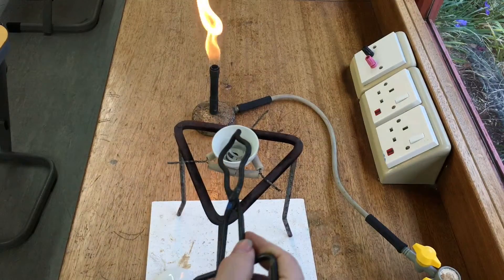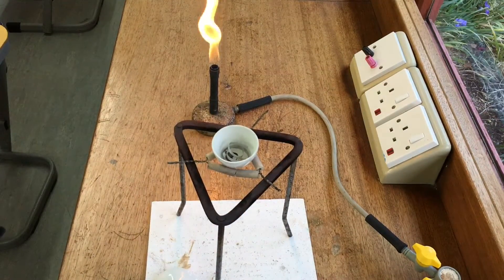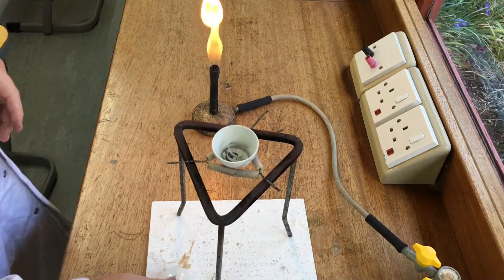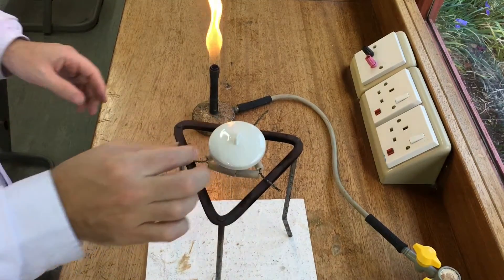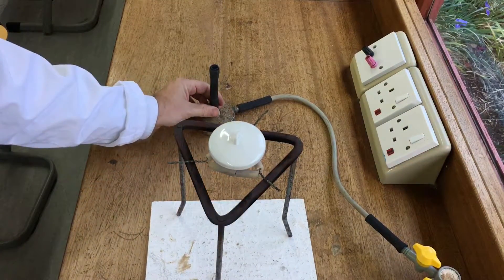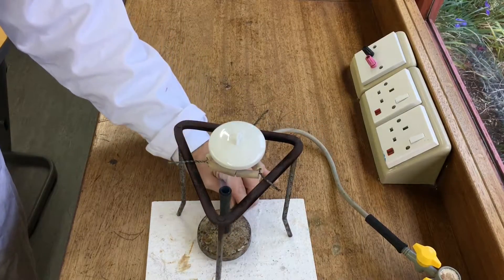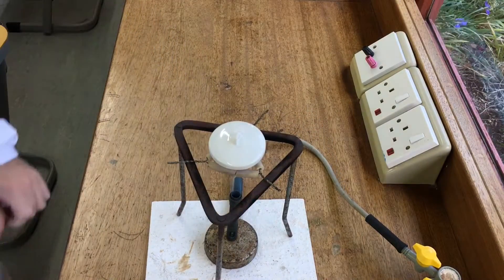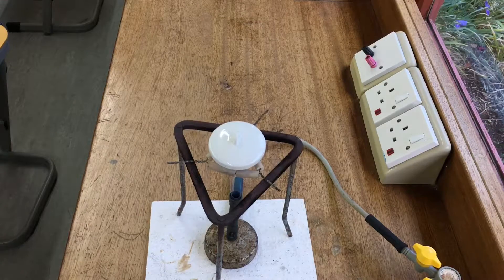So we take the magnesium, which we've pre-weighed. We put the lid on top of the crucible, we turn the Bunsen onto a hot flame, and we heat until such time as all the magnesium has turned into white magnesium oxide.